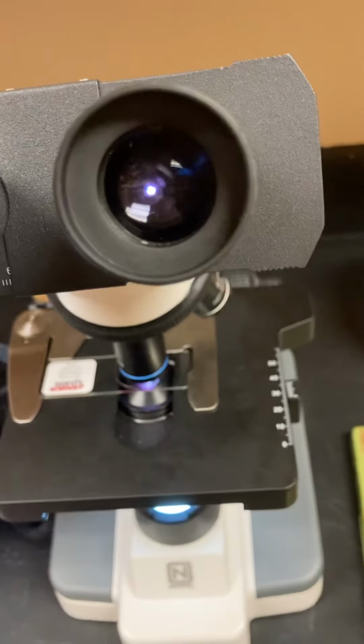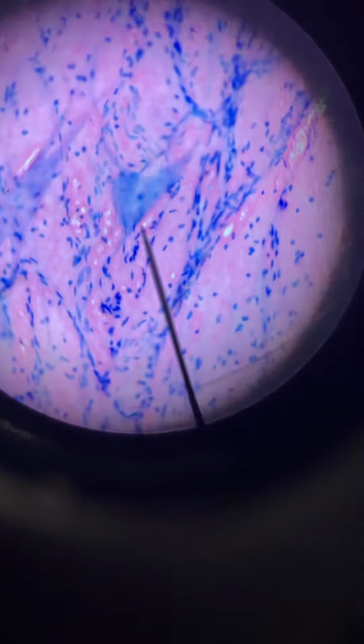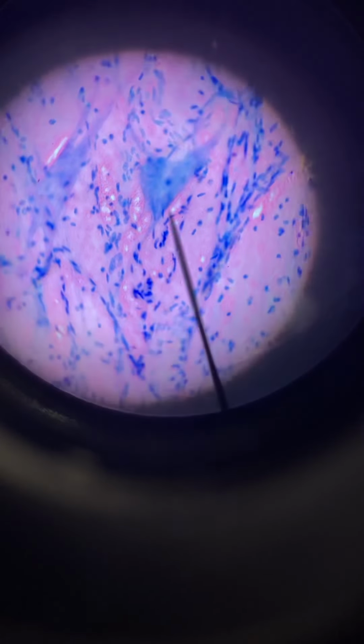I have a microscope slide set up here also. And it's neat that these cell phones now can zoom in on microscopes. See that white dot there? If I just go closer and closer and closer to that white dot, we can see there. Now that's hard to keep it still. I'll do my best. There. The pointer is pointing to a blue cell body of a neuron. You can see the faint nucleus. And we can see some extensions, axon and some dendrites.